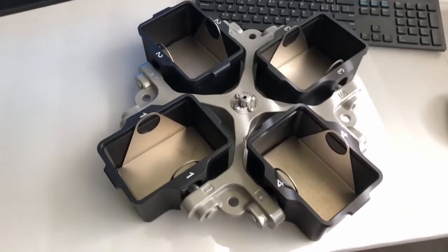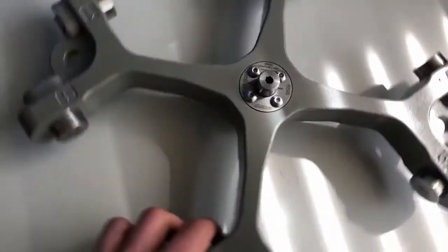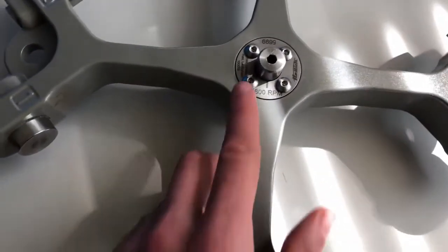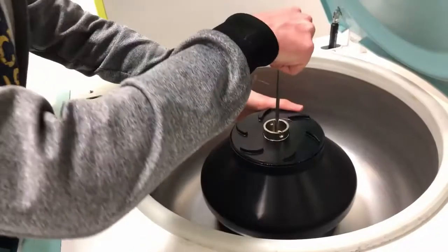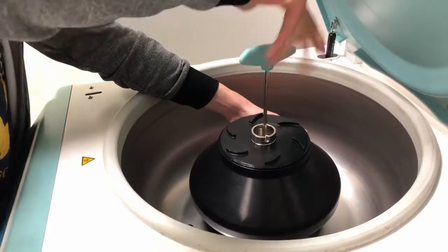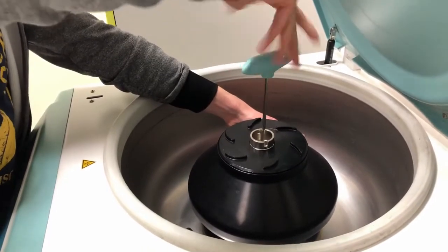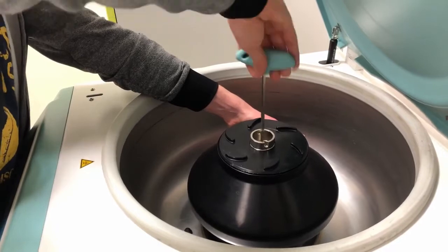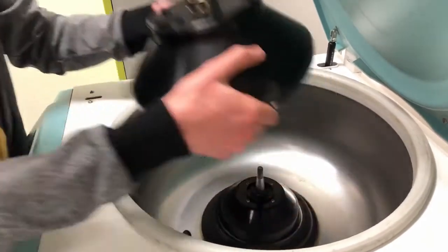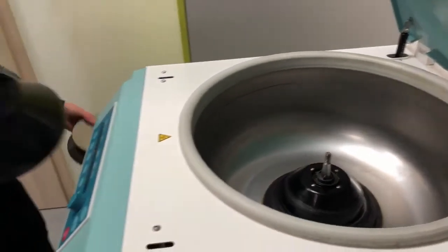There are a lot of different types of these. Check the maximum RPM on the top and middle and remember these lines. We use them for aiming at the rotor changing time. If you want to change this one, start with this T-shape key and turn to the left, then grab the rotor, be careful and switch for another one.